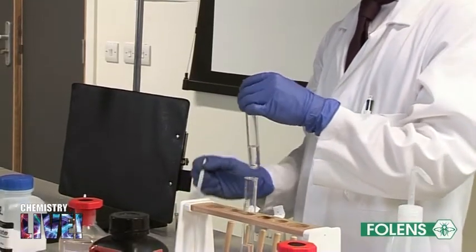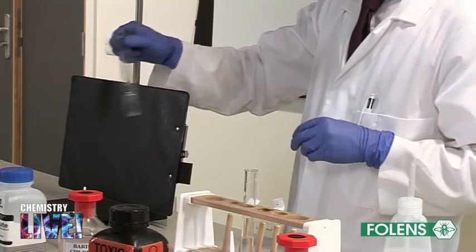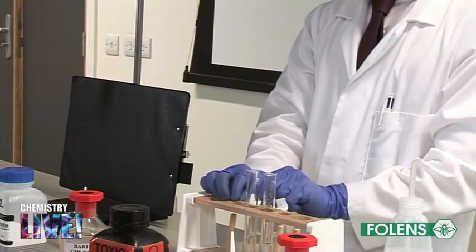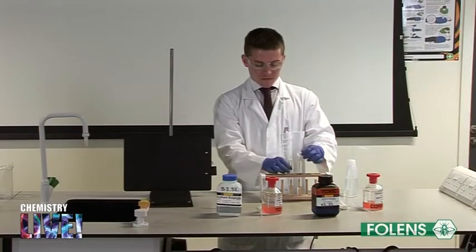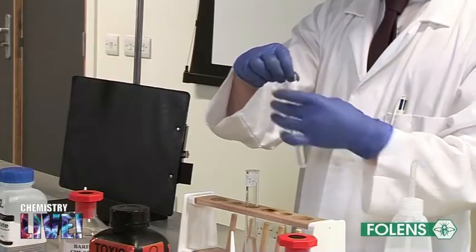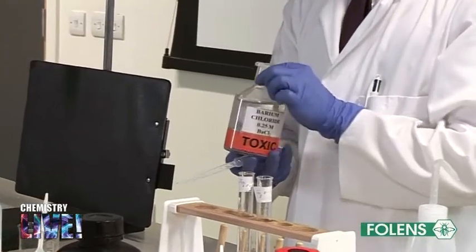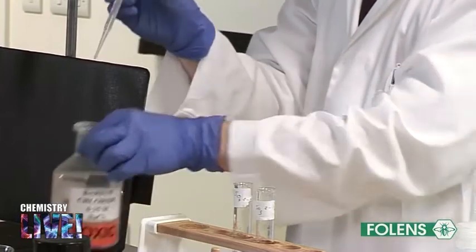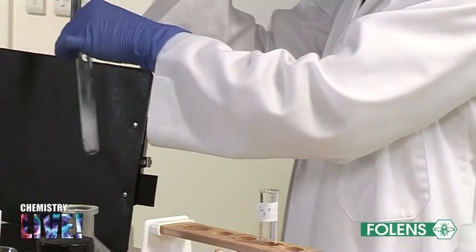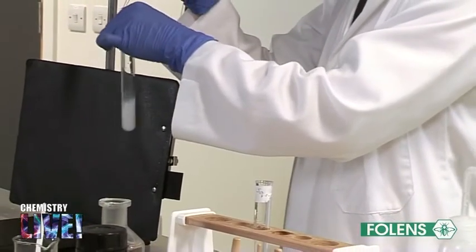Make up a solution of the sulfite salt in a similar fashion. Label each test tube. Using a clean dropper, add a few drops of barium chloride solution, BaCl2, to the clear solution in each test tube. Note that the clear solution in each test tube turns cloudy and a white solid material settles out of solution.